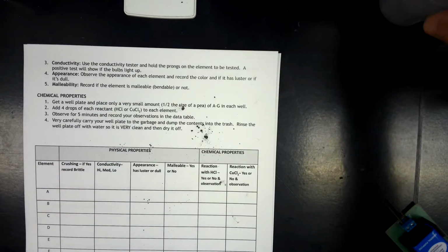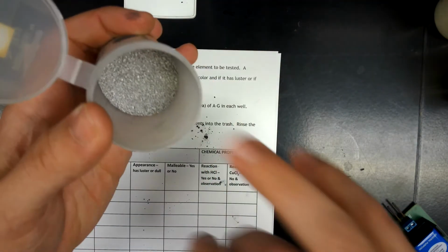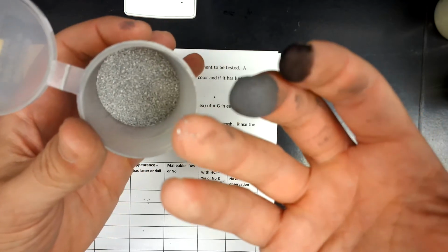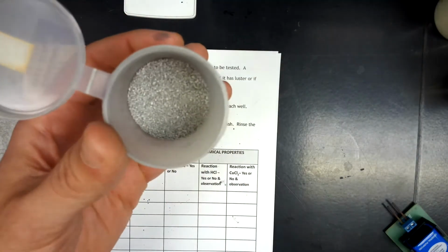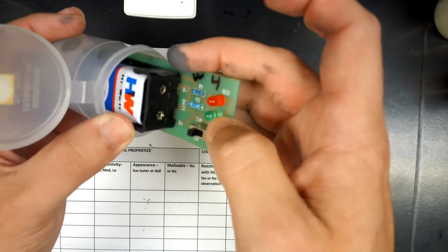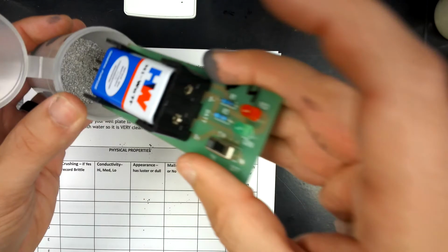A, B, C, D. So this one, little tiny particles, hard to tell. It is gray. Let's see. Fingertip comes off with a couple pieces, but not coated in it. So that means it is malleable, but not crushable, even though there are such fine particles. That can sometimes throw you off. And once again, I'm getting that medium to high conductivity based on where I put it. Yeah, this one might even be high conductivity.